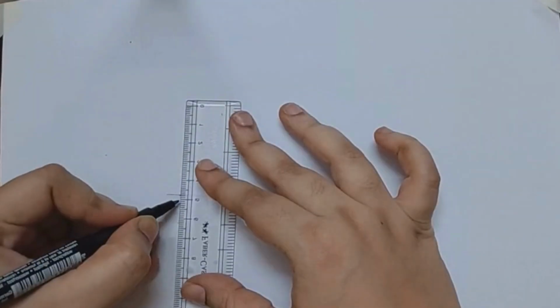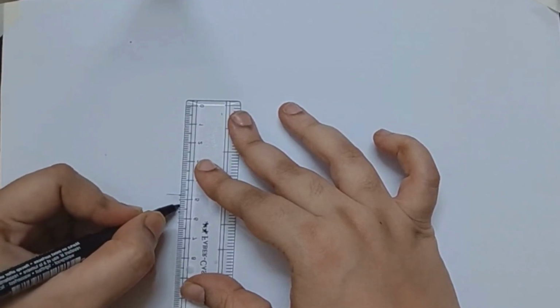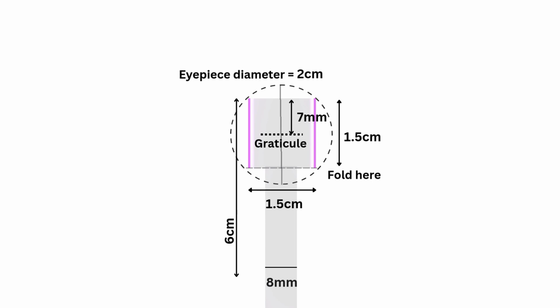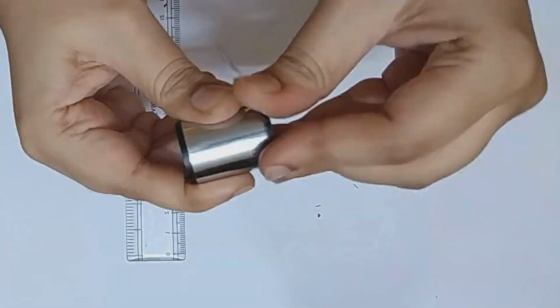At about 7 mm from one end of the strip, I marked 10 dots, each 1 mm apart. Here is the design of the graticule I made. I folded the strip at 1.5 centimeters from the base and kept the holding part at 8 millimeters so it could sit snugly inside the eyepiece. You can adjust the length and the width based on your eyepiece measurements. And finally, I inserted the strip near the field lens of the eyepiece.